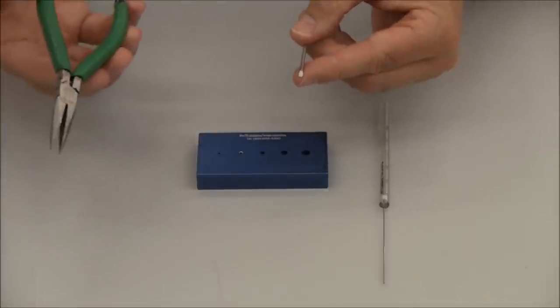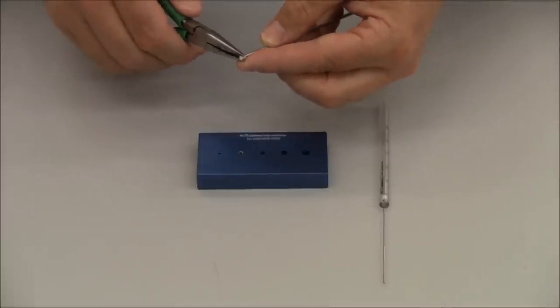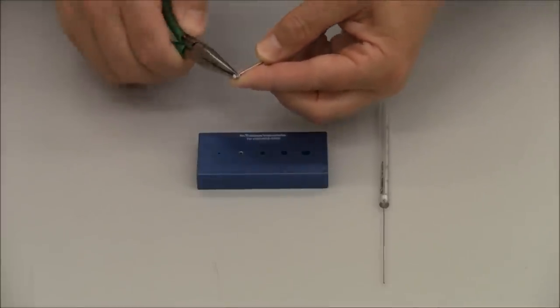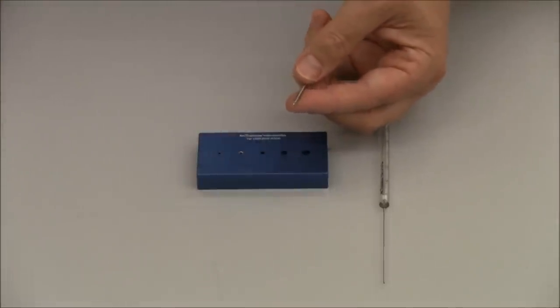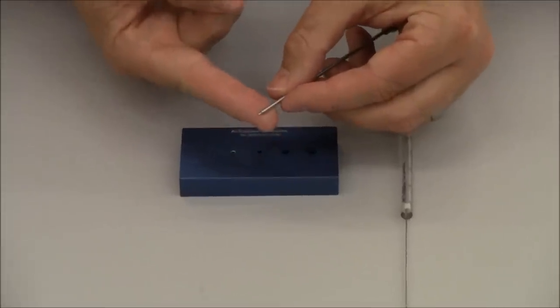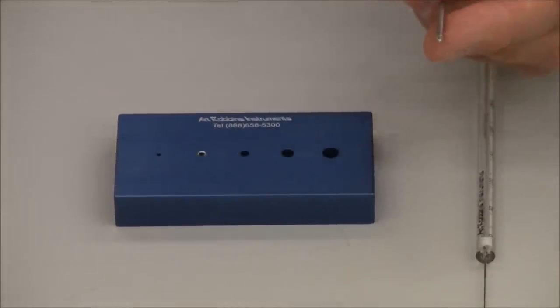You need a pair of needle nose pliers. Be sure not to grab it too hard. Nice and easy. You pull the Teflon tip off. Just like that. Underneath, you'll notice there is a hose barb, like a harpoon, that holds the Teflon tip on.